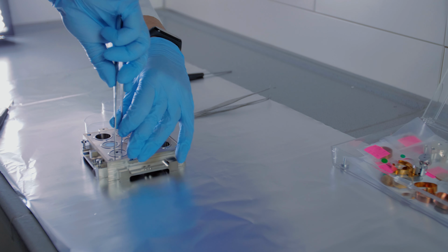When we are dealing with metal samples, the variety of questions is large. Most metal samples are alloys where different crystalline regions need to be analyzed, or the topmost layer of an alloy needs to be determined. Also, impurity studies are common, where oxide or hydride distributions are analyzed throughout the material. Our ToF-SIMS has also been used for process control analysis by depth profiling and cross-section imaging of electrochemical deposition of different layers on metals.